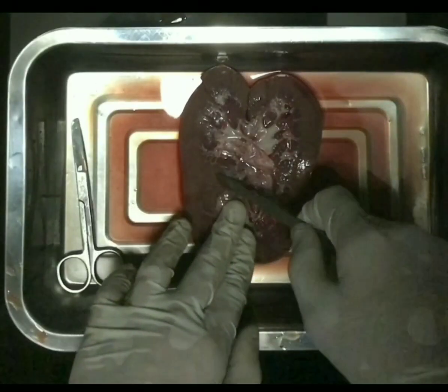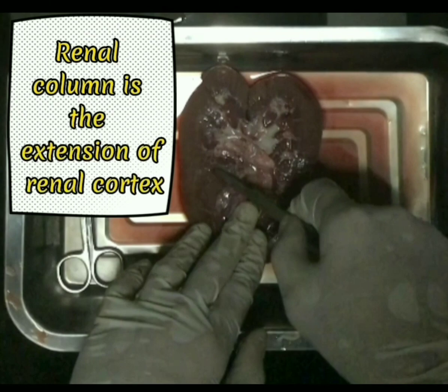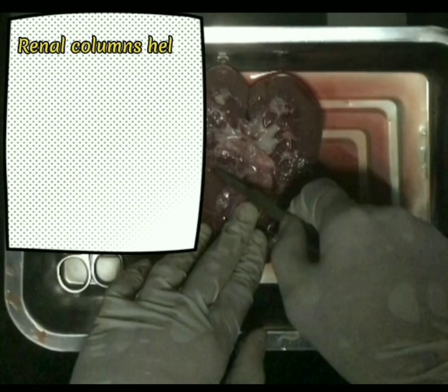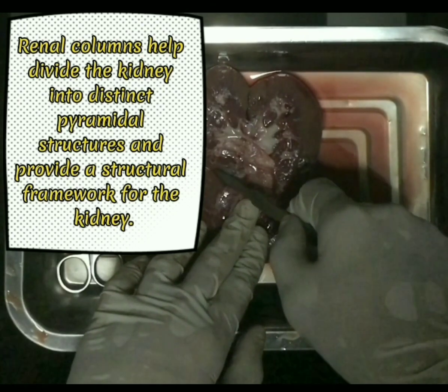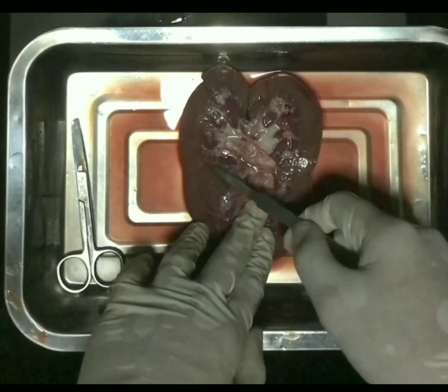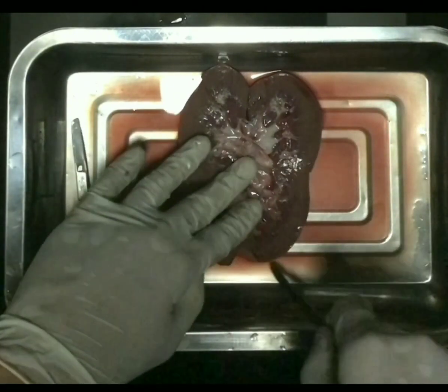What I will point now is the renal column. Renal column is the extension of the renal cortex. These columns consist of renal cortex tissue and play a role in supporting the structures within the renal medulla. They also contain blood vessels, nephrons, and collecting tubules. And lastly, renal columns help to divide the kidney into distinct pyramidal structures and provide a structural framework for the kidney. If it's lighter, it is the renal column, and if it's darker, it is the renal medulla.